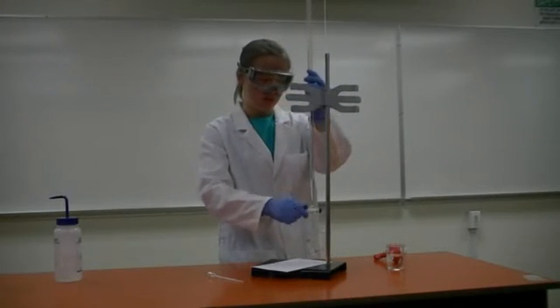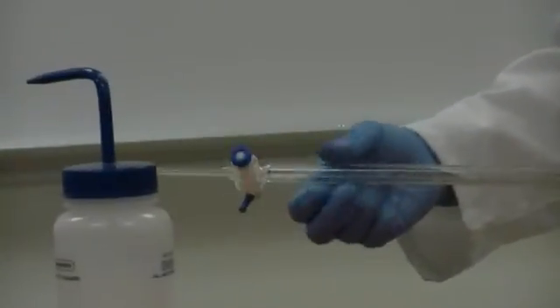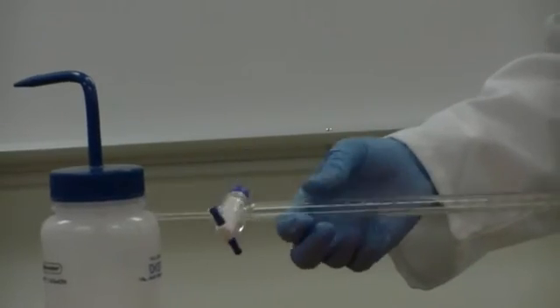Let's get started. So here's a close-up of the rinsing. Remember, the inside of the burette should be coated with solution.